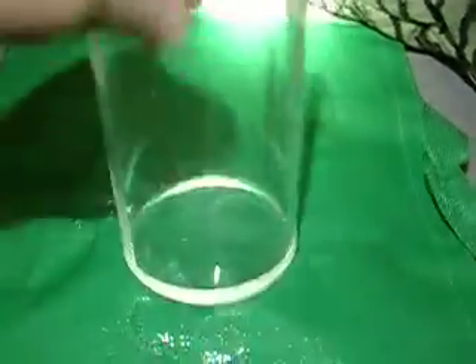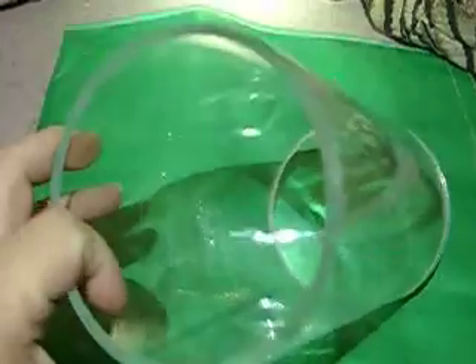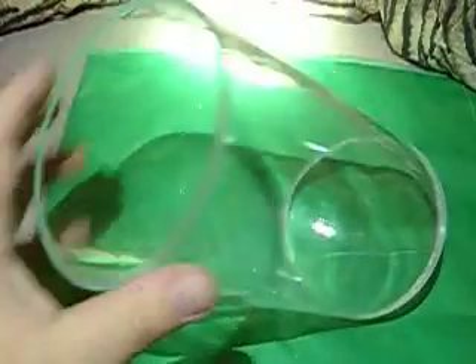This is the vacuum chamber that I got from the ambulance parts. This is the water trap — it's actually a piece of solid tubular plexiglass, thick like quarter inch. It's actually machined out with a groove here, and it's super high quality. There's a bracket to attach it to the ambulance, which I'll use. I'm going to put a rod on this and attach it to my chemistry set.